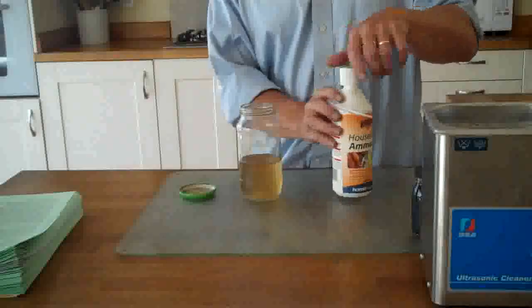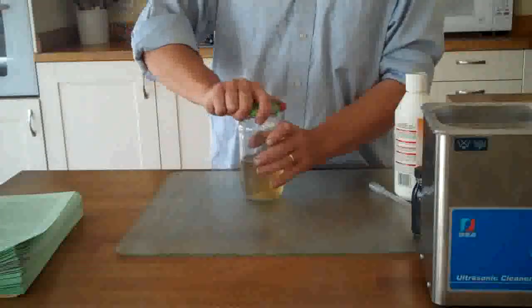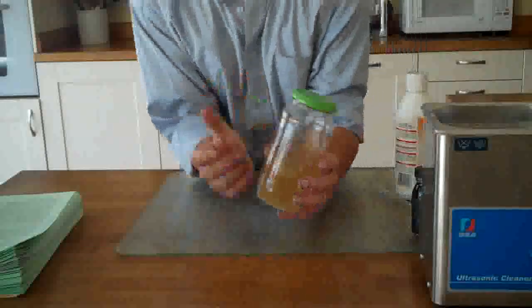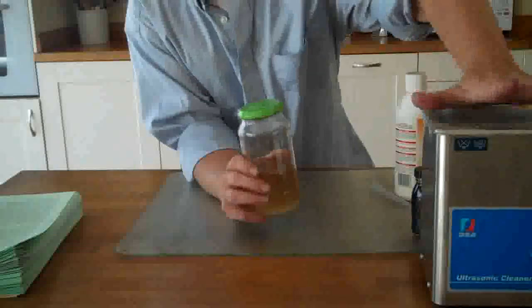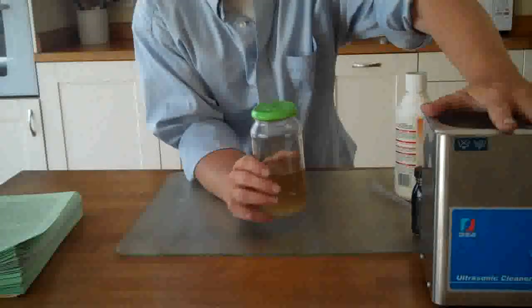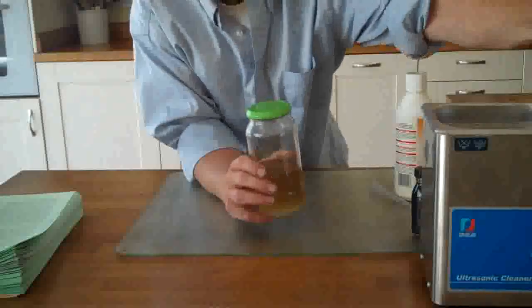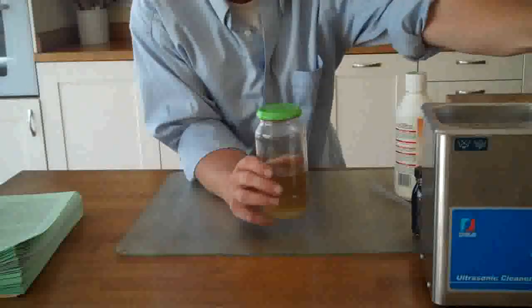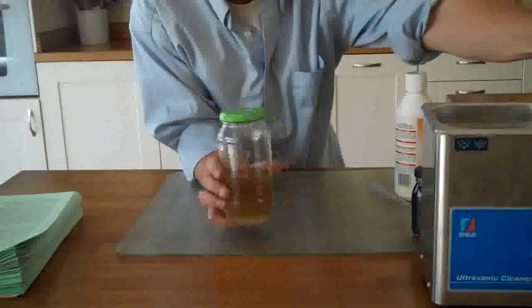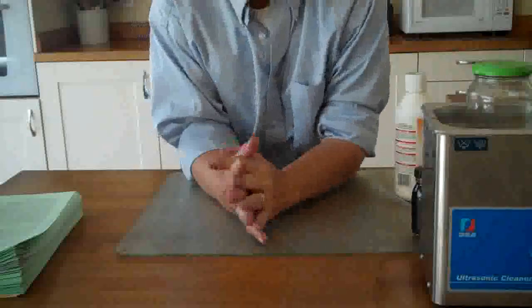And that's all there is to it. Now what we need to do is heat it, and we have 2 options. I'm going to put it in my sonicator — a 50 watt bath sonicator. The good thing about it is it has an on/off button, so all I have to do is turn it on and it will sonicate away. You pop it in the sonicator water bath, turn it on, and leave it for an hour.